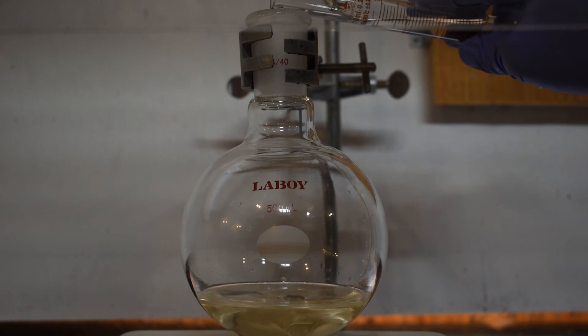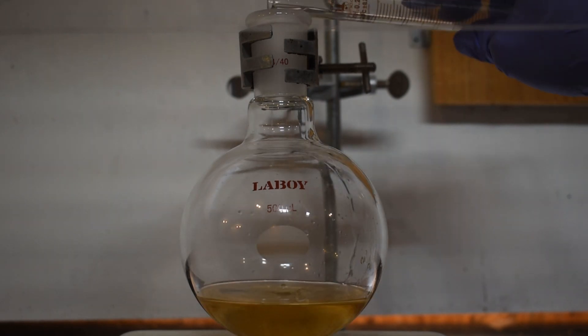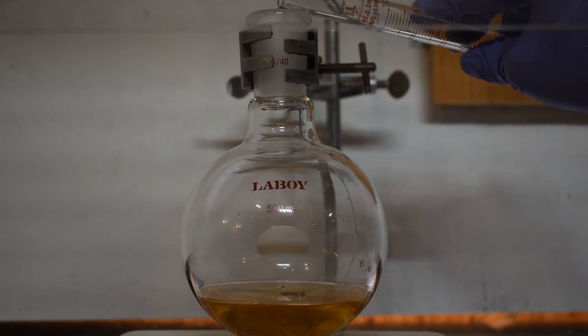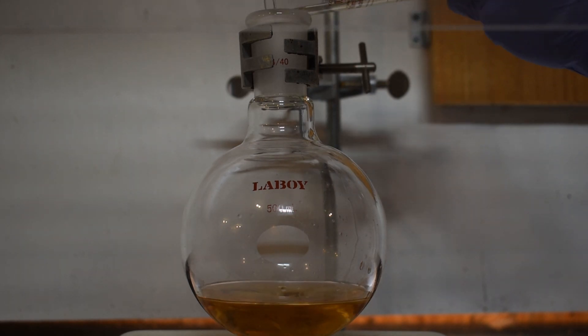As you can see though, the mixture still heated up a lot, and a lot of the impurities from the sulfuric acid ended up decomposing and giving our mixture this amazing yellow color.